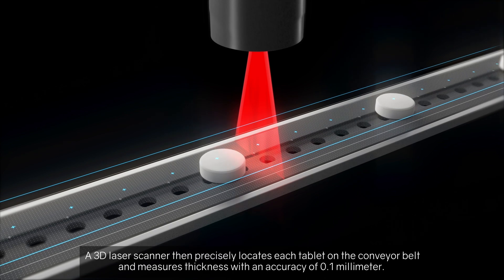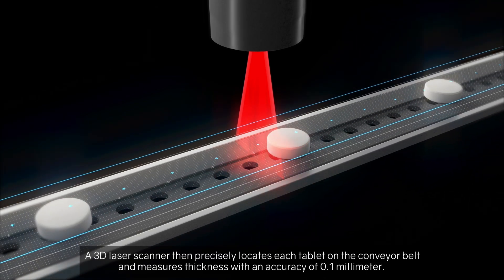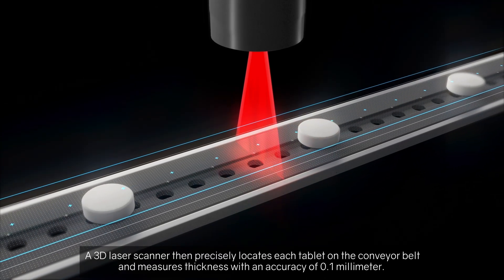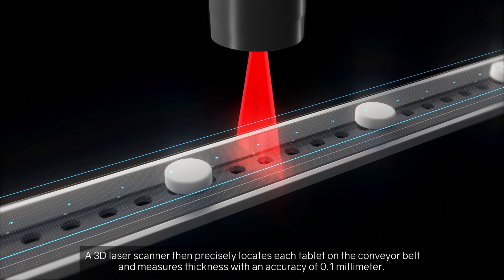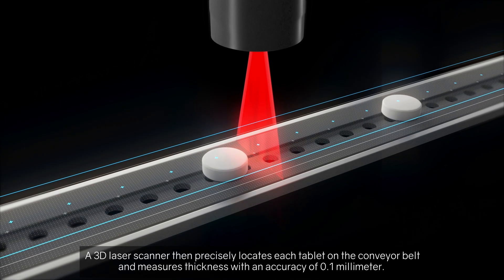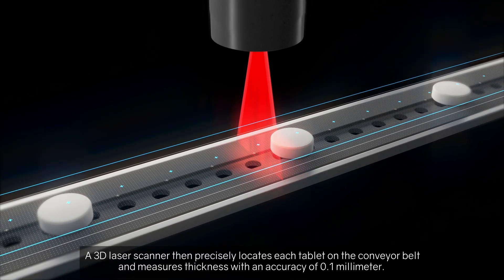A 3D laser scanner then precisely locates each tablet on the conveyor belt and measures thickness with an accuracy of 0.1 mm.